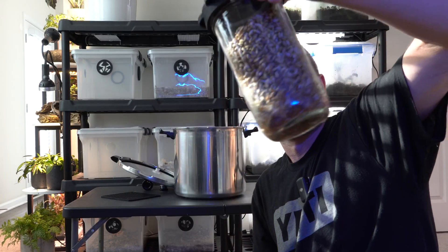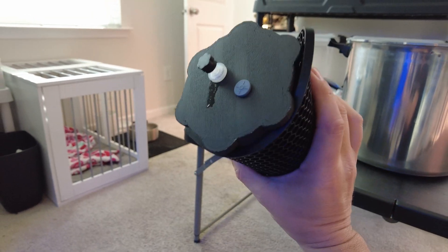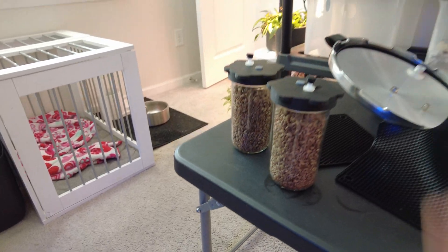We skip the soaking, skip the simmering, skip the drying — all those steps. The one step we can't skip is the hot shake. Basically it helps distribute any extra moisture among the grains. Don't forget to tighten your lid too. Now everything in this jar is sterilized and ready for inoculation. The grains are probably still a little too hot right now, so I'll set these two jars aside. Soon we'll take these grain jars to the next level by inoculating them and starting a new grow. That's the lazy, quick-and-dirty, easiest way of creating a sterilized grain jar.